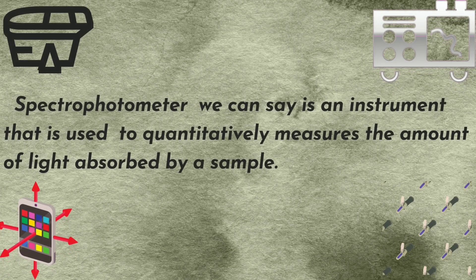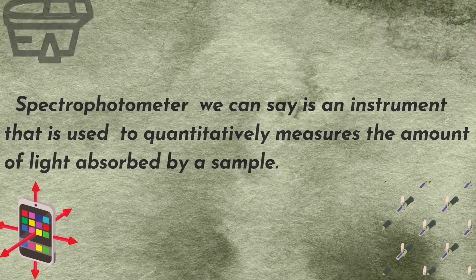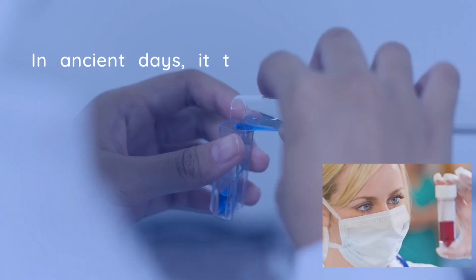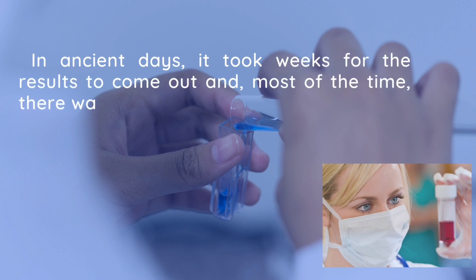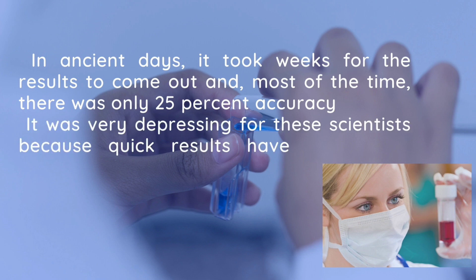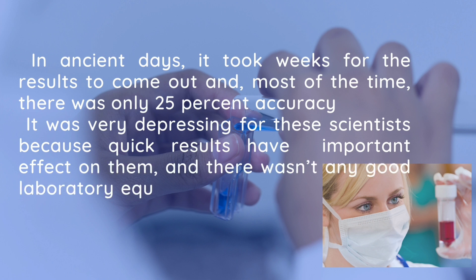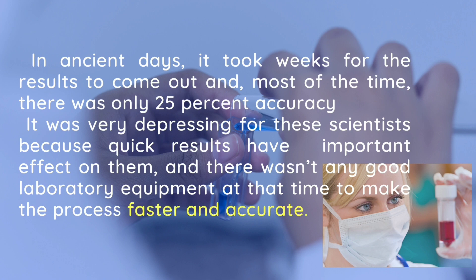What is spectrophotometer? We can say it is an instrument used in quantitative analysis and to check the amount of absorbance of light by a sample. Times ago, it was very difficult and depressing for scientists as it took very long to perform an experiment with no or less accuracy, which may be 25% or less, due to lack of laboratory equipment. So this device is basically the need to collect faster and accurate results.